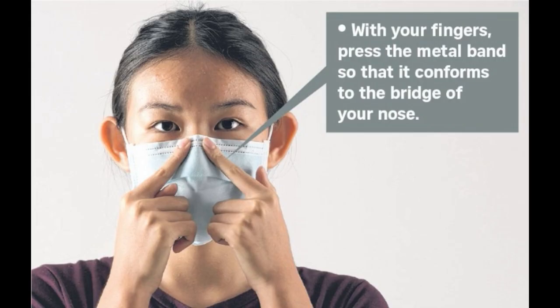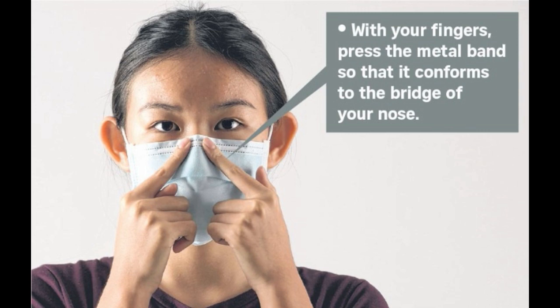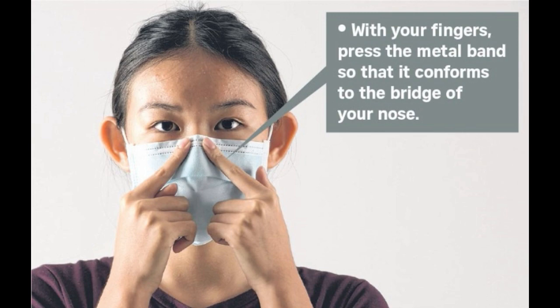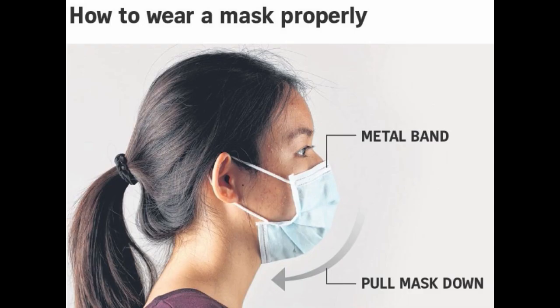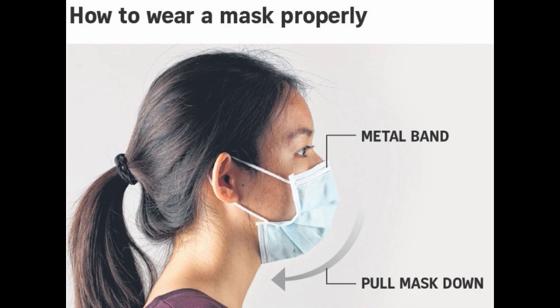Adjust the mask to fit the contours of your face. There is a metal wire or thin strip along the upper edge — press it onto the bridge of your nose to form a seal. Pull the lower edge down to cover your chin. The mask should fit snugly.